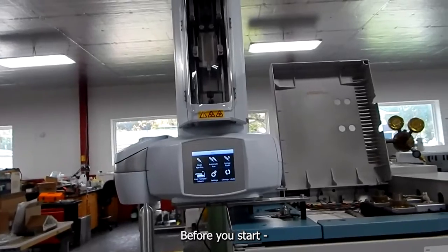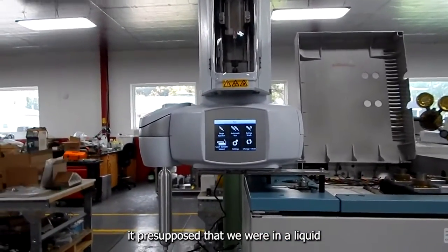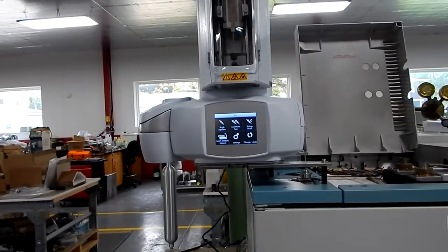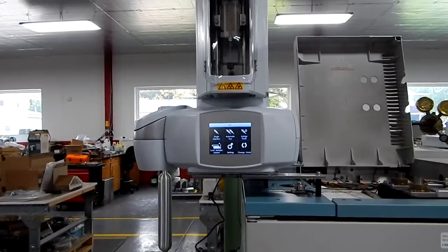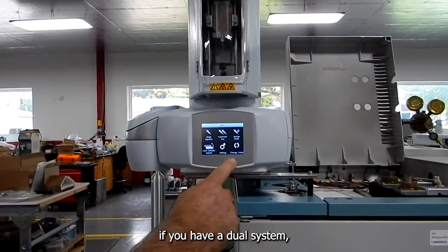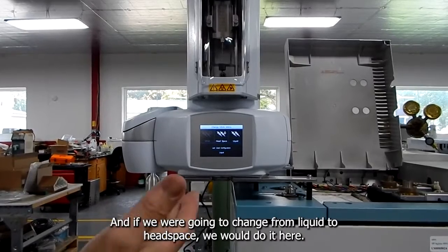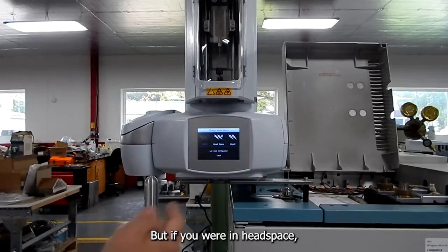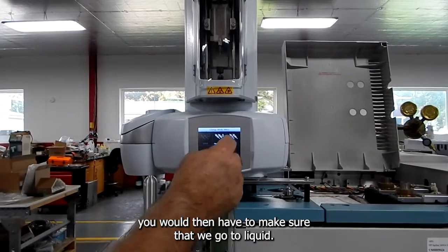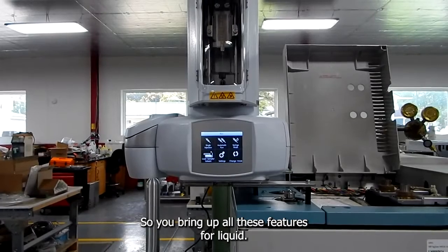Before you start, it presupposed that we were in the liquid rather than headspace. And to change modes, you have a dual system. From the run page, you go to change modes, and if we were going to change from liquid to headspace, we would do it here. But if you were in headspace, you would have to make sure that we go to liquid to bring up all these features for liquid.